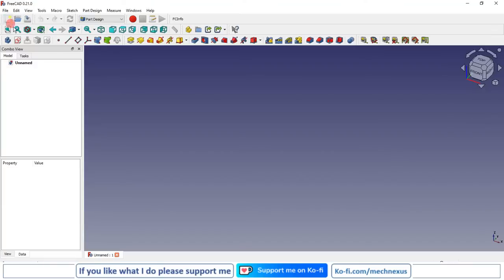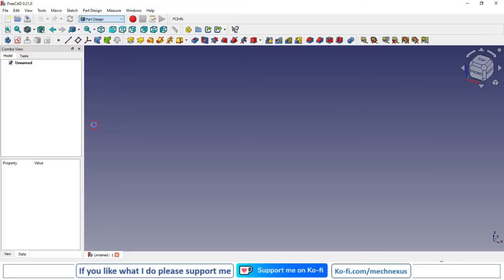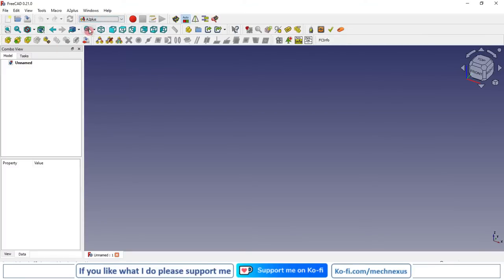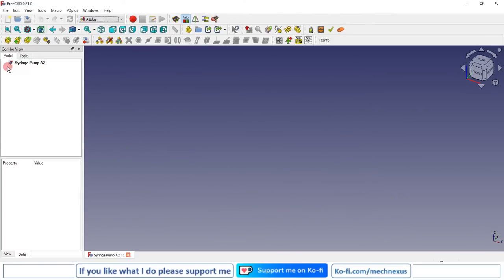Now I will create a new file, and from here drop down I will switch to the A2 plus. So you can see that tools of A2 plus Workbench has been activated. Now I will save this assembly. I will give it a syringe pump A2 and I will save it. So you can see that name has been updated. Now here we have the options of A2 plus, and from here we will add part to the assembly.